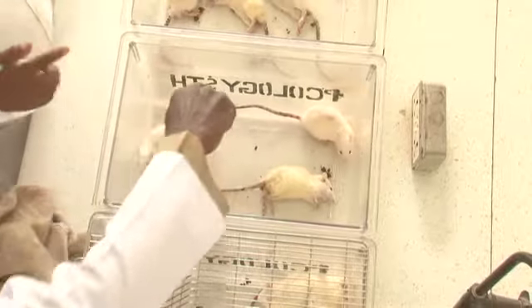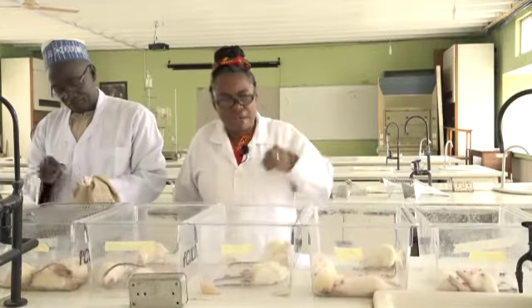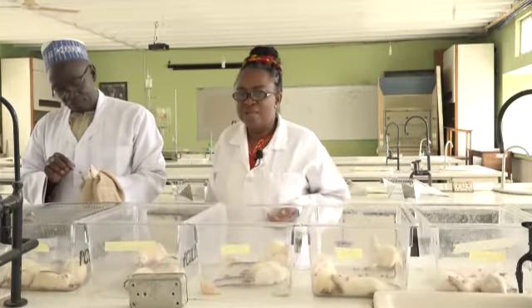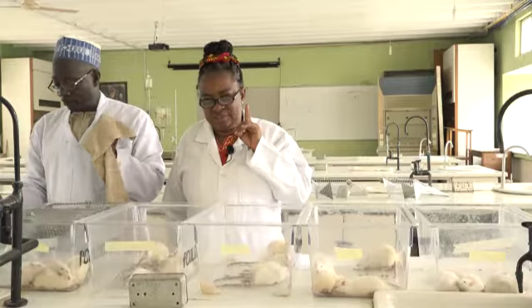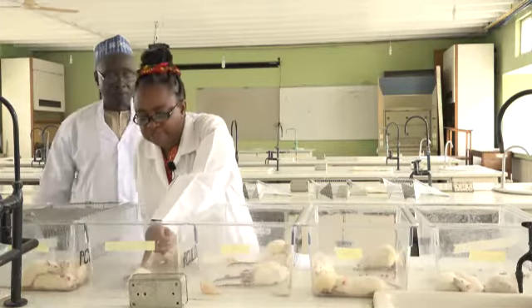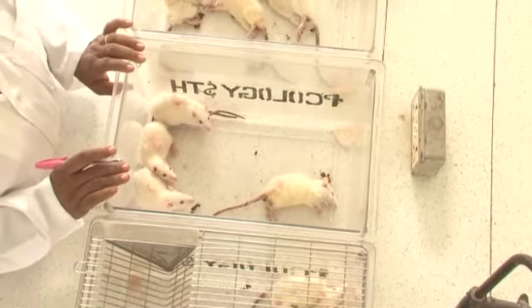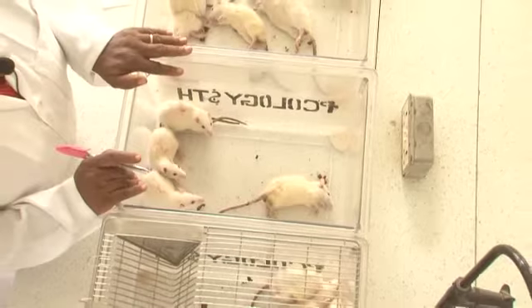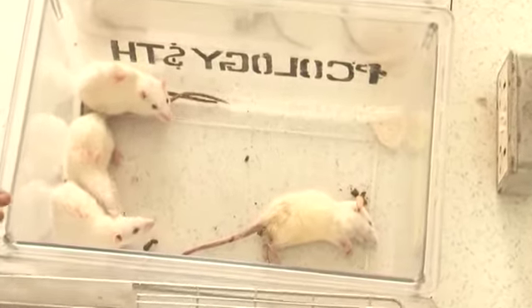It's a bit artificial because in real life, the antidote doesn't come so quickly. But we are trying to pass on a message to you. The interesting thing is, although this rat received a poison and received an antidote immediately, he still died. You must not forget the effect or the role of biological variation. We are all different.